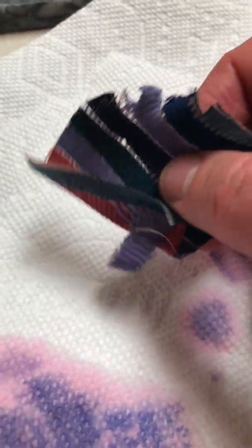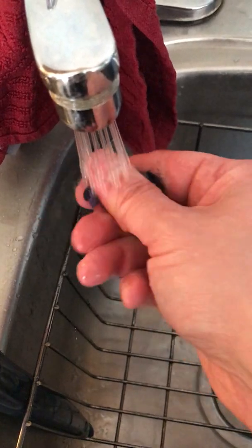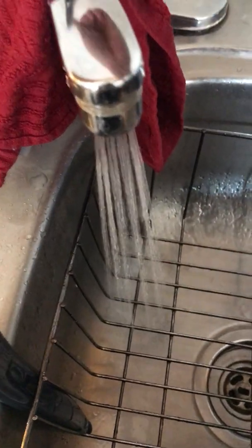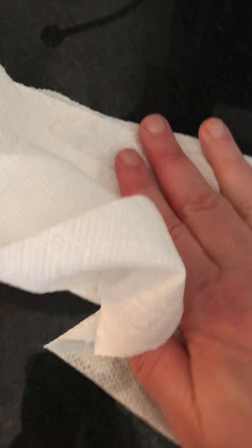So that's what it looks like when it's all done. Now that we've blotted it dry a bit, we're going to go take it and rinse it. Let's take it over to the sink. We want to rinse it in warm water for a little bit — essentially we're just trying to rinse off the excess dye. Then we're going to squeeze it dry again using a couple more paper towels. And we'll bring it back into the good light and see what we can see.